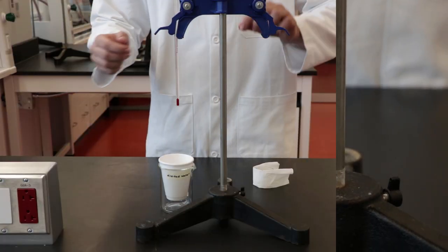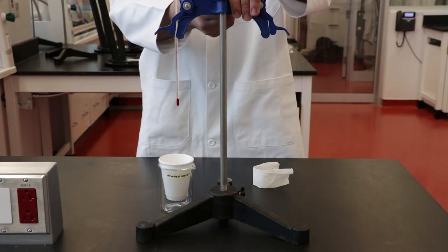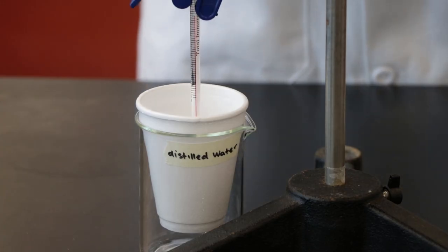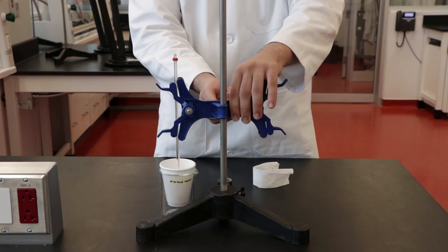Wait one minute and then lower the thermometer into the reaction mixture and measure the temperature. Continue to do so for the next four minutes at one minute intervals.